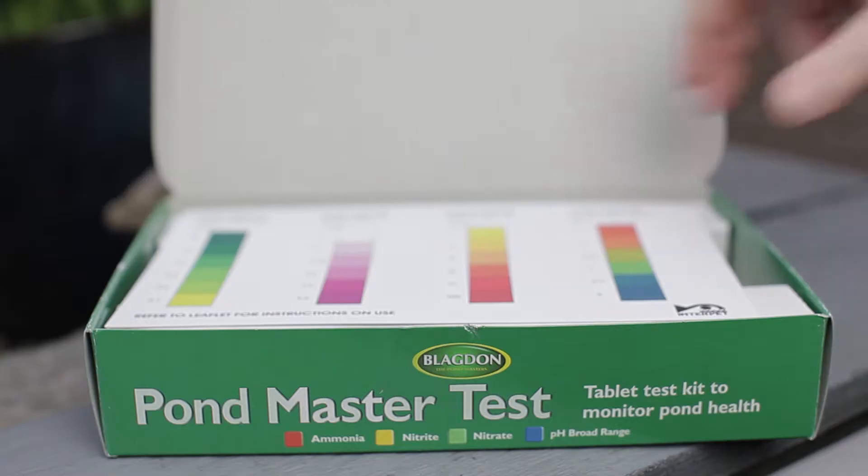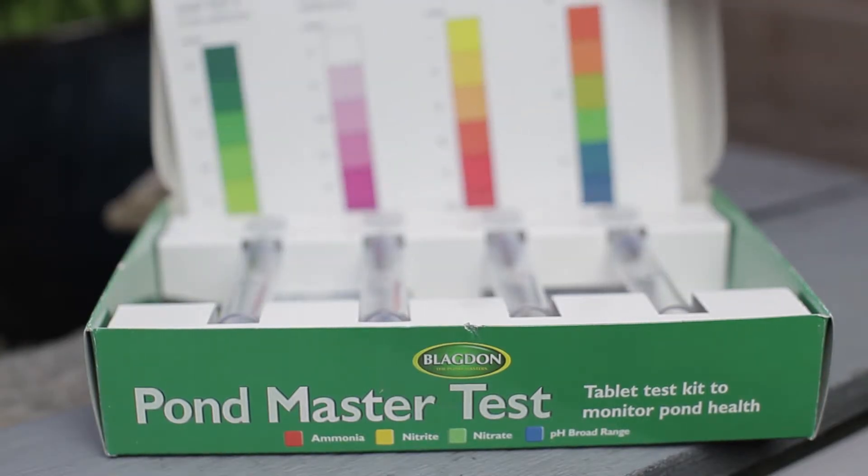Using the Blagdon Pond Master Test Kit you can easily test for ammonia, nitrate, nitrite and pH.